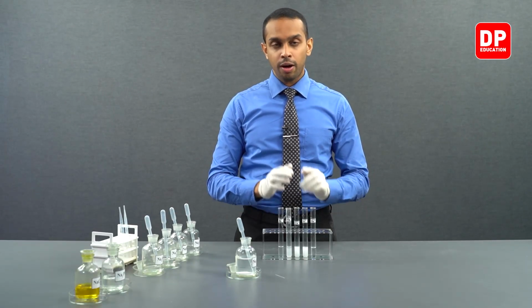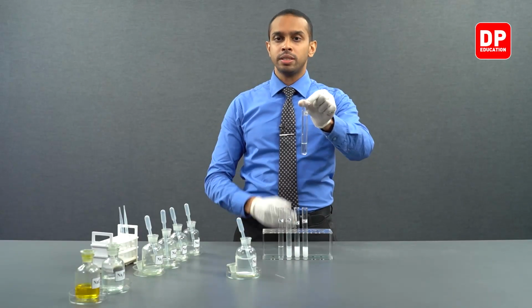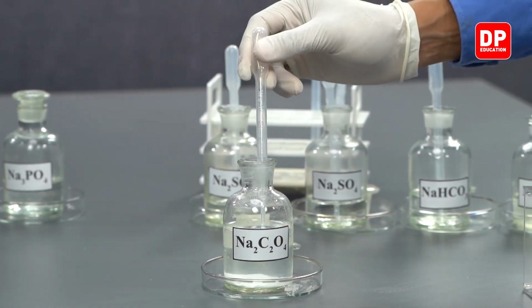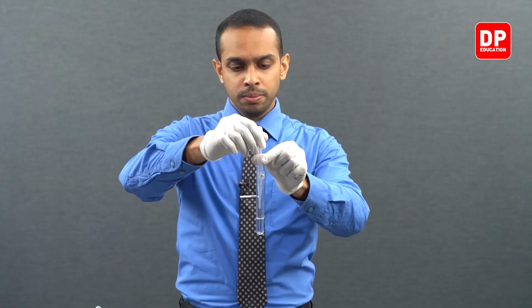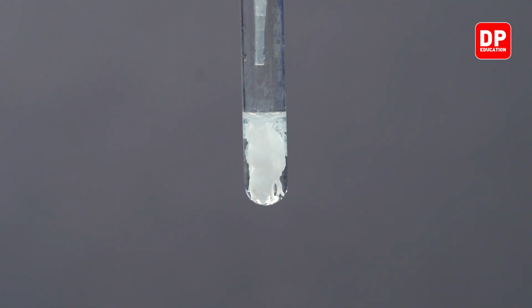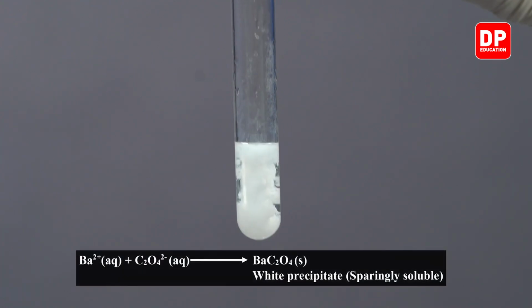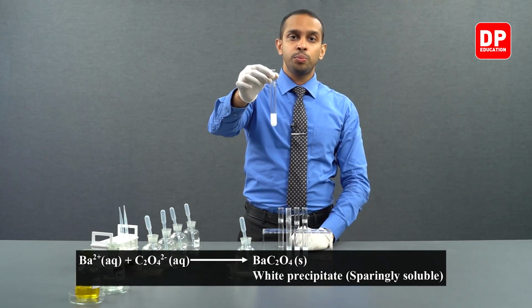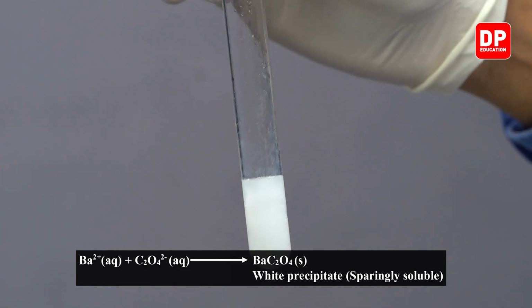Finally, we have our barium 2+ aqueous ion solution. Let's take our barium 2+ aqueous ion solution, and just like we did before, we'll add a small amount of oxalate anion solution into this barium cation solution. You can see as soon as you add a small amount of oxalate anion to barium 2+ cation solution, we form a white color precipitate.